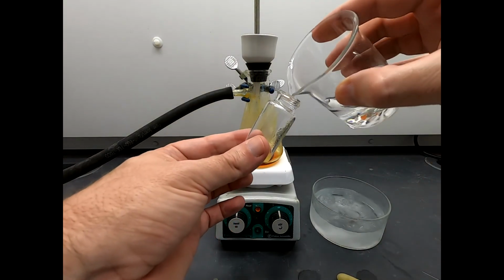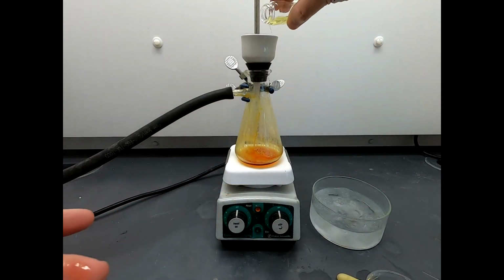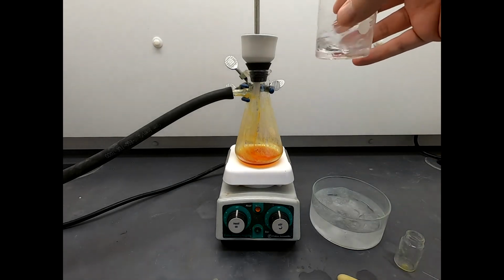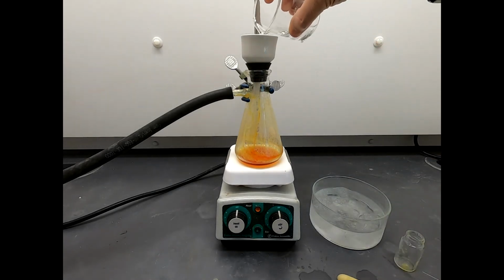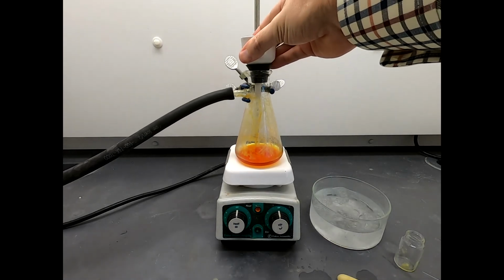And tell you what, why don't we just do this? That's a little more fun to see. Pour that through. And now, well, I don't have quite what I want here, but this is fine. I'm just going to pour this straight through. Looks good. Okay, that is drawn through.